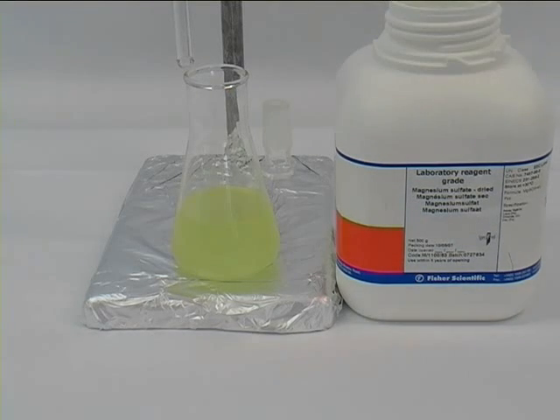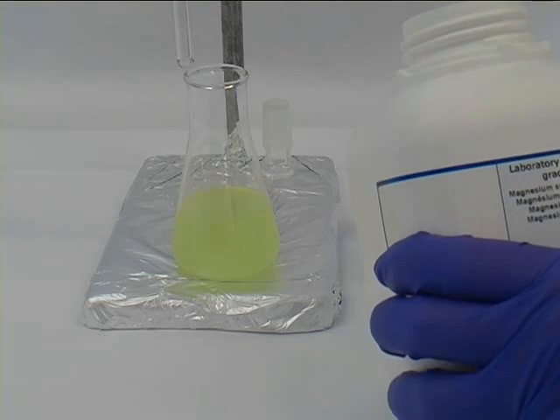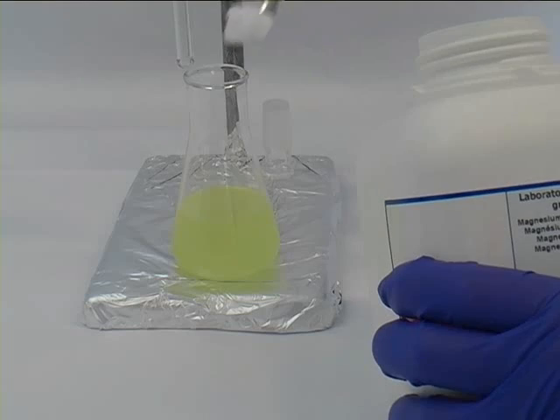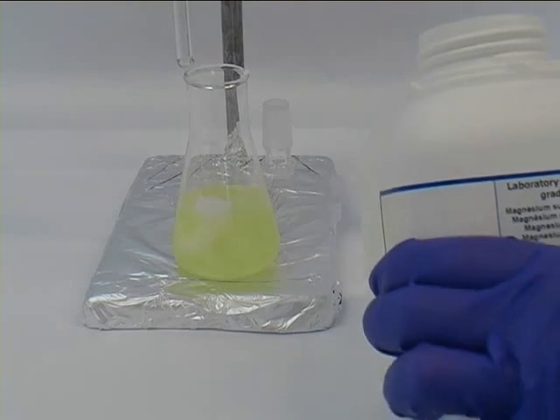Drying is achieved with anhydrous magnesium sulphate which has the property of attracting molecules of water, so it will remove any residual water in your organic phase.